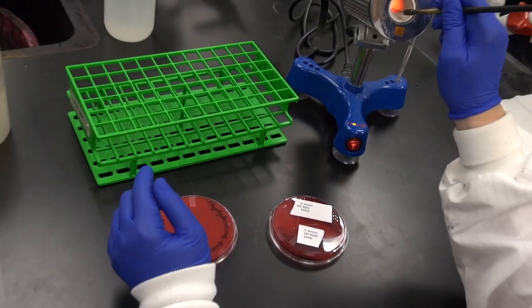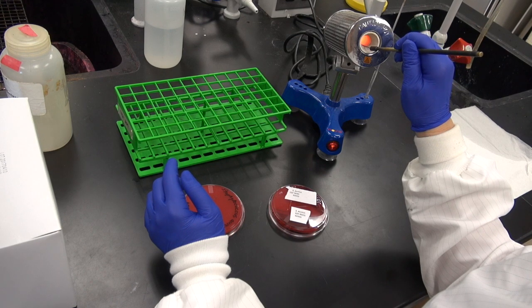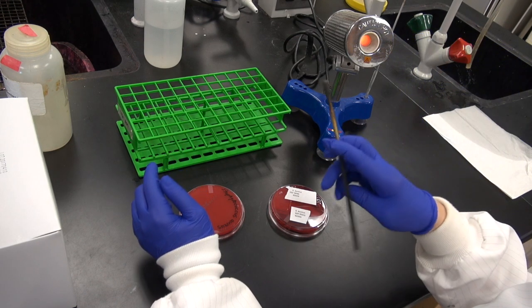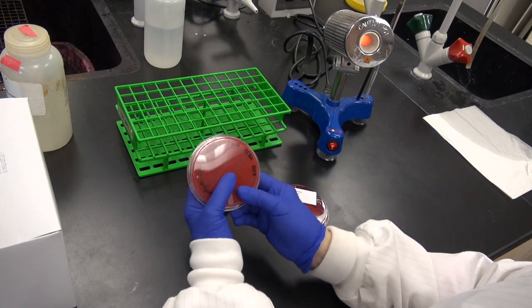Re-sterilize the loop before putting it back. Your newly streaked plate is now ready to be incubated.